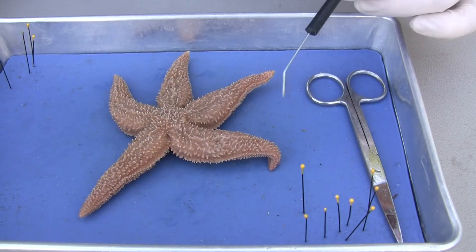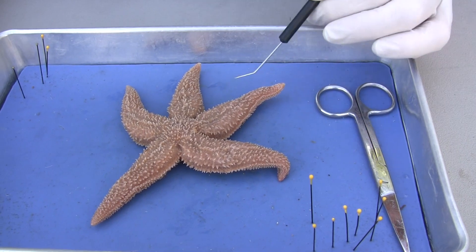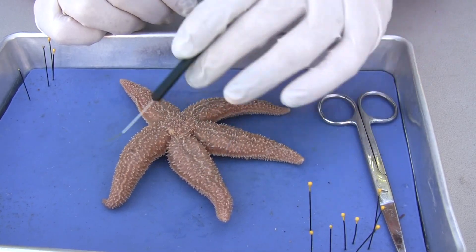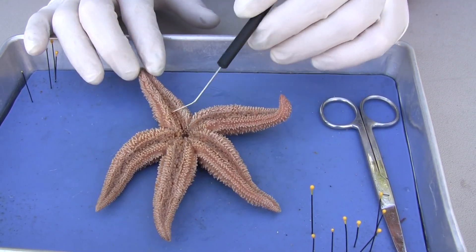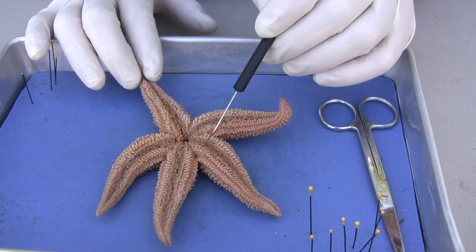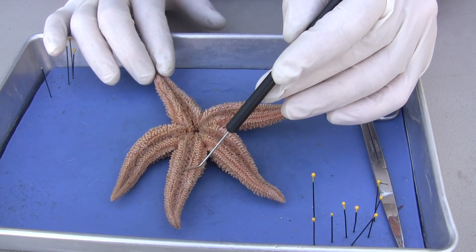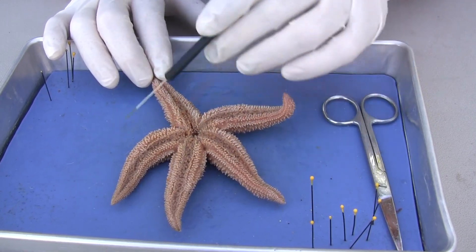This is not bilaterally symmetrical. This is the only radially symmetrical organism we're going to be dissecting in class. The last two were bilaterally symmetrical. So I'm going to turn it so you can see a couple of the parts. Here we've got what we call the aboral surface — the top part is the aboral surface. And this side is the oral surface because this is where the mouth would be. So oral surface is where the mouth is and all of its tube feet. It has a lot of little tube feet right down in this groove in each of the rays of the starfish — this is called the ambulacral groove. You can see the individual tube feet here that they use for movement. And here's its mouth. This surface is the oral surface.